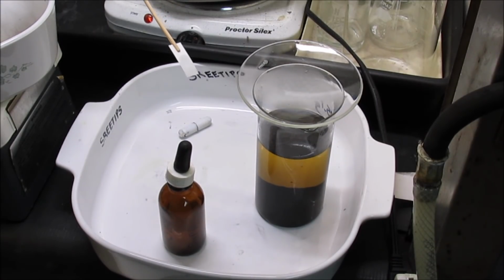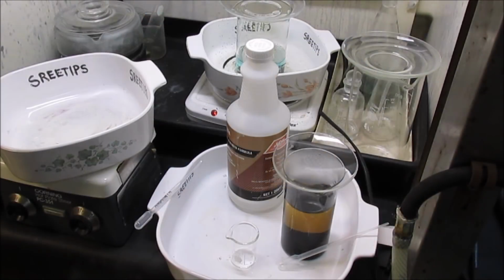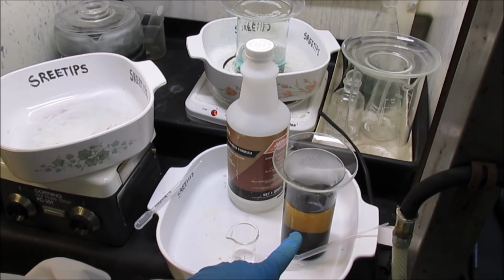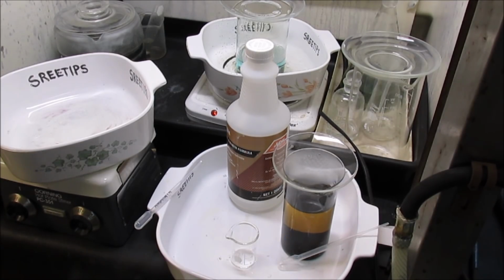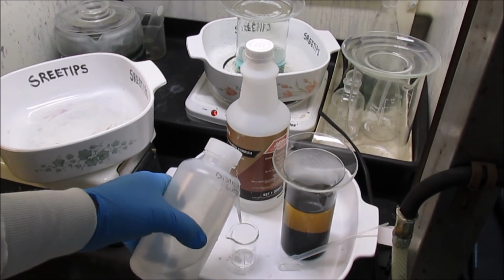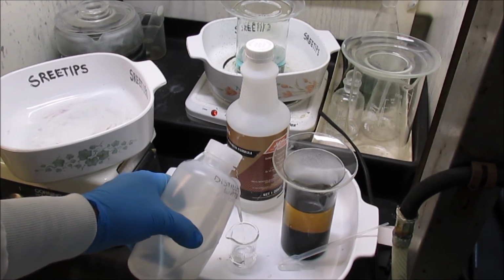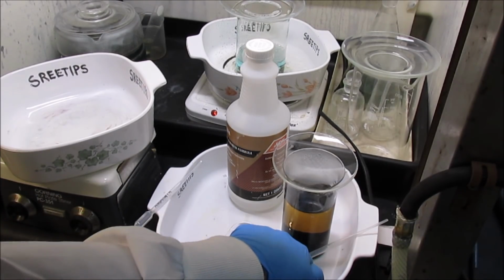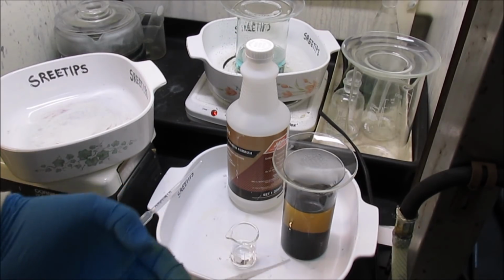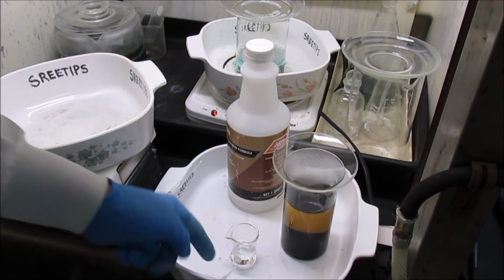And that test is negative. Got no indication of precious metals in solution. Now I'm curious to see if I got any copper in solution here with that hydrochloric acid boil. So to test that solution, I'm going to put a little bit of distilled water in this little beaker here. And then I'm going to get a little bit of the waste solution off the top of the PGM powders here and add it to this solution.